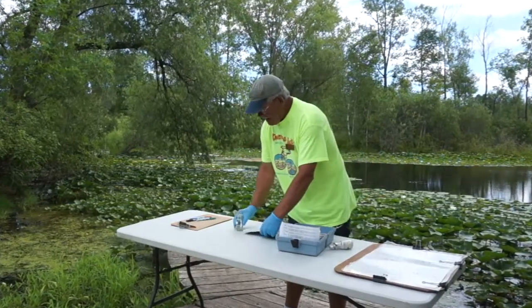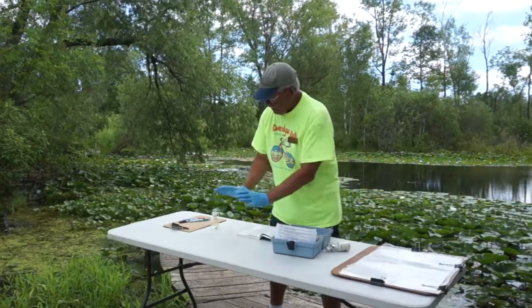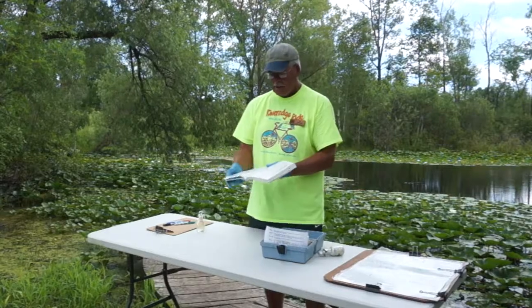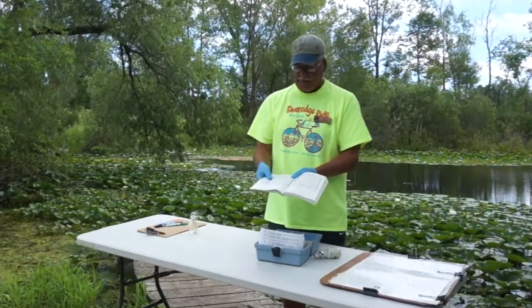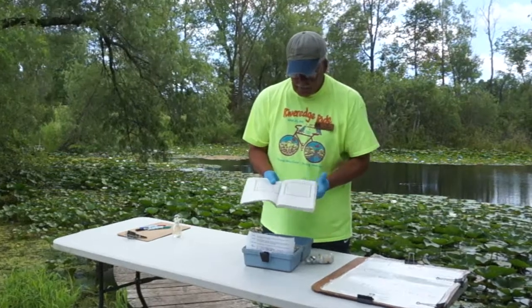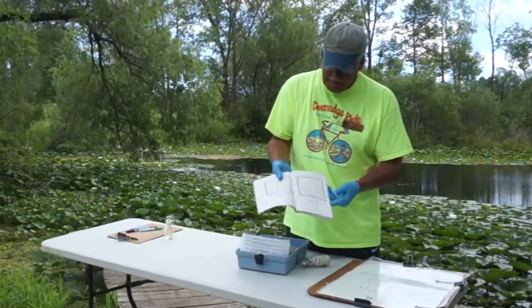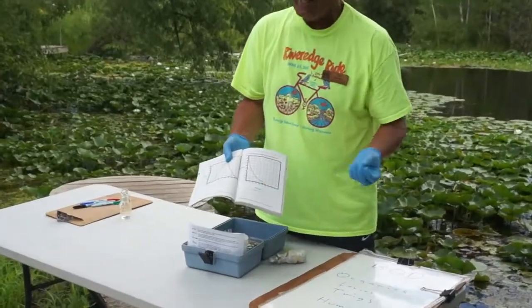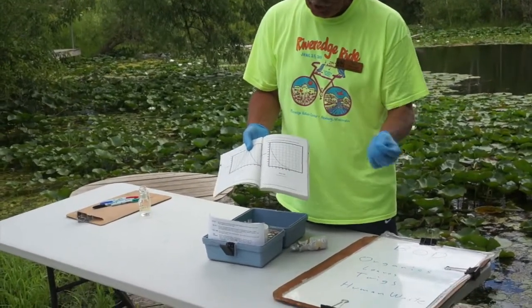Okay? So now, we perform this test, we get 10, we get a difference, we subtract the 12 milligrams per liter minus 10 milligrams per liter. On here, chart number 4, we're looking at the difference between the two. That's down here in the bottom. That is a quantitative number, 2.